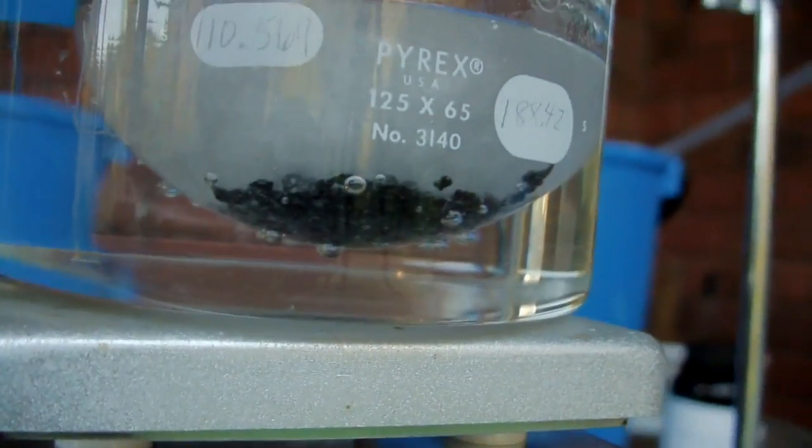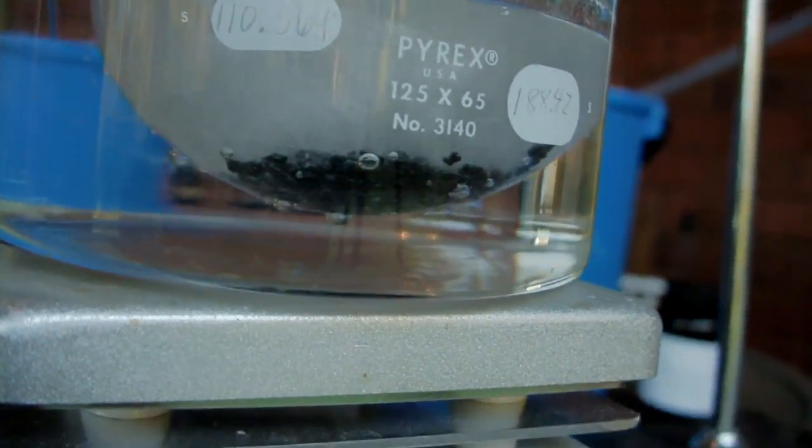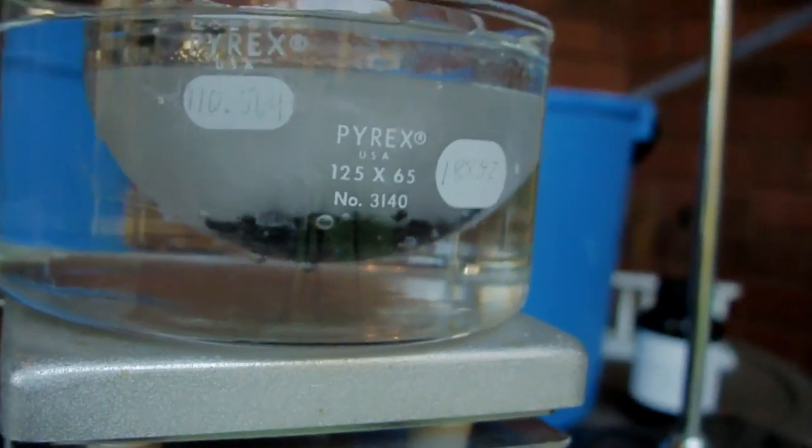And I've also added boiling chips. That's what the black pieces are. The boiling chips are going to help this thing boil.